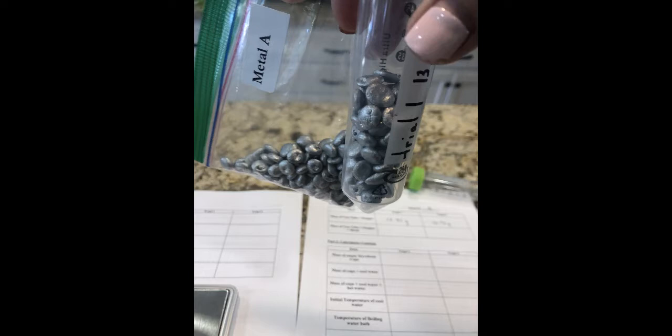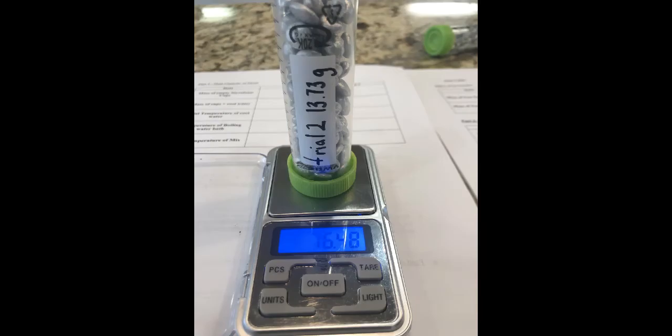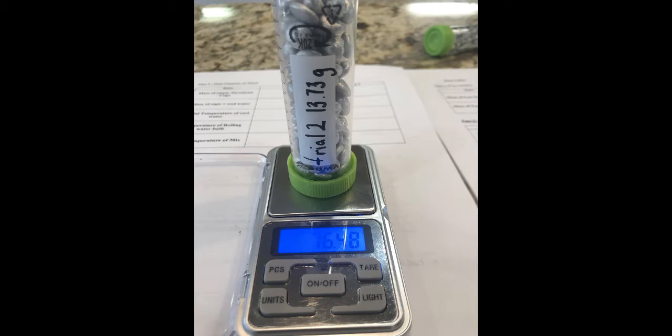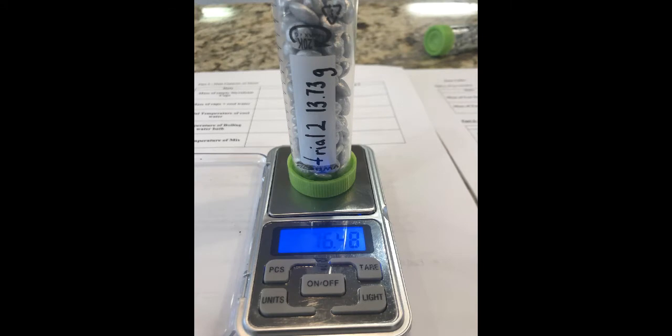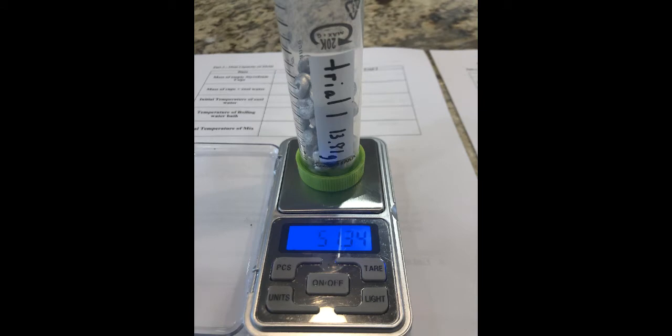Step 3. Now you're going to put half of the metal in the first test tube and the other half in the second test tube. If you don't divide them exactly in half it's totally fine. We'll know how much is in each test tube by its mass.